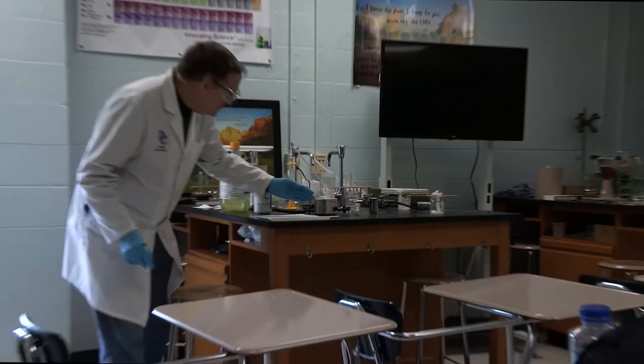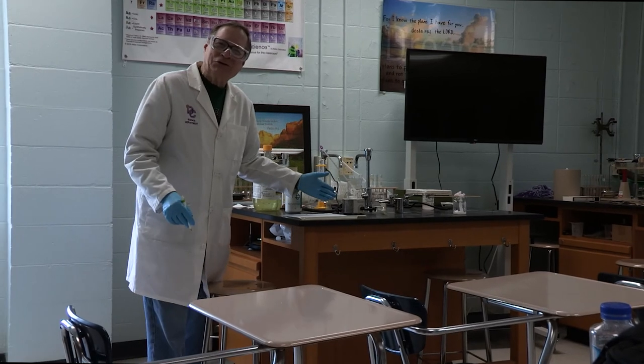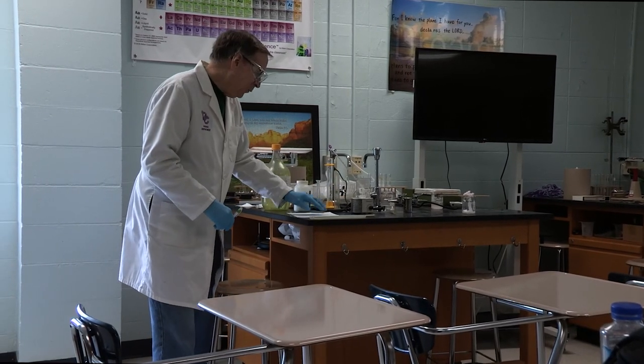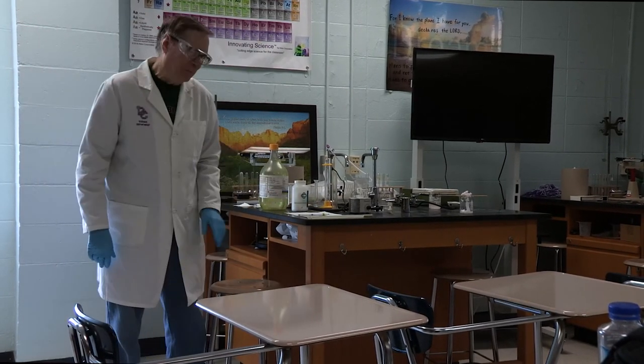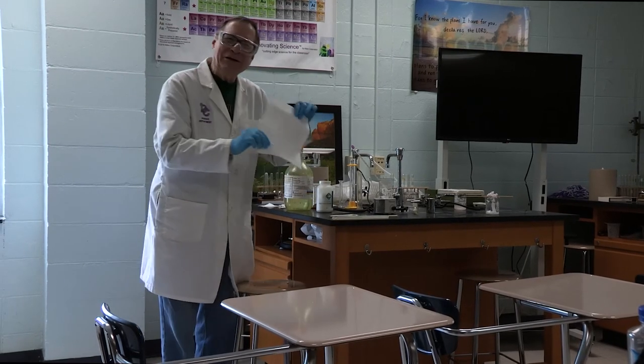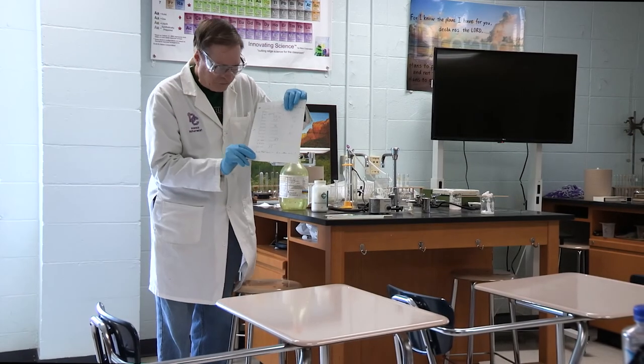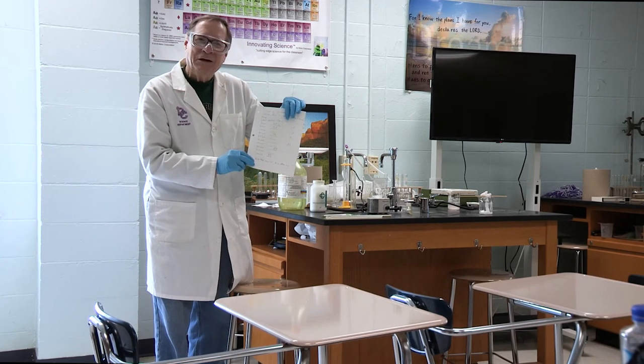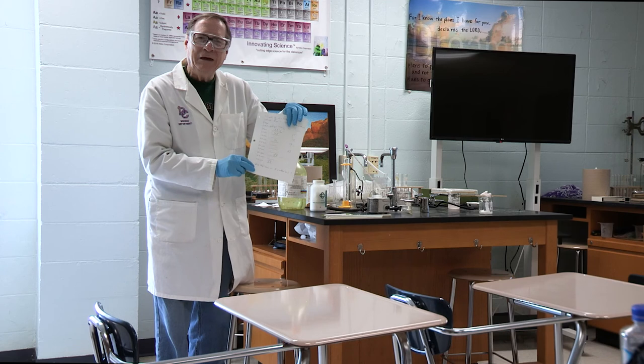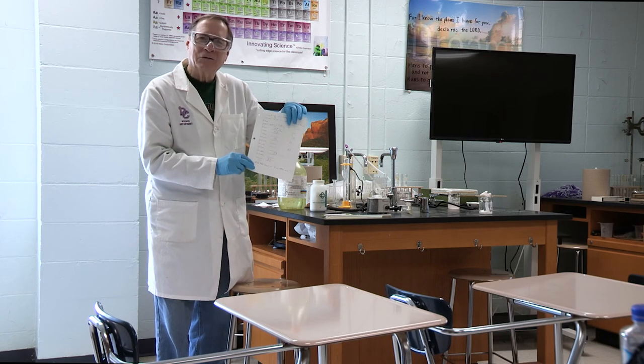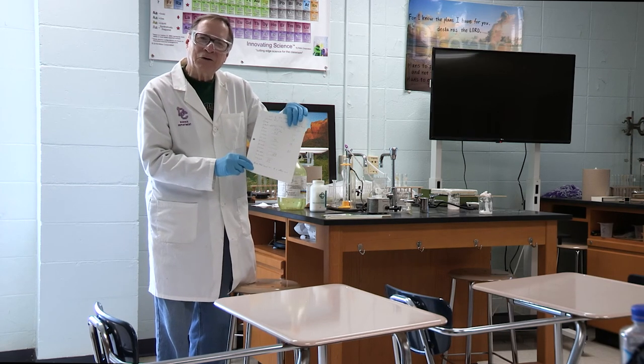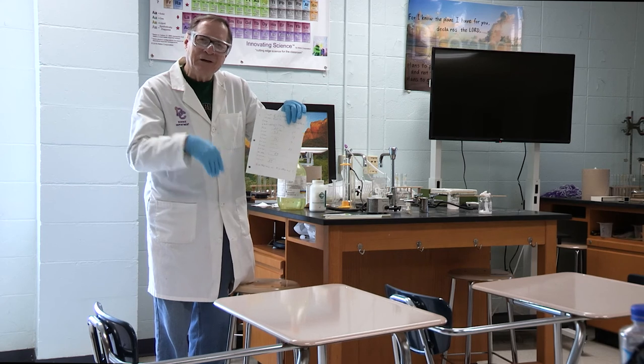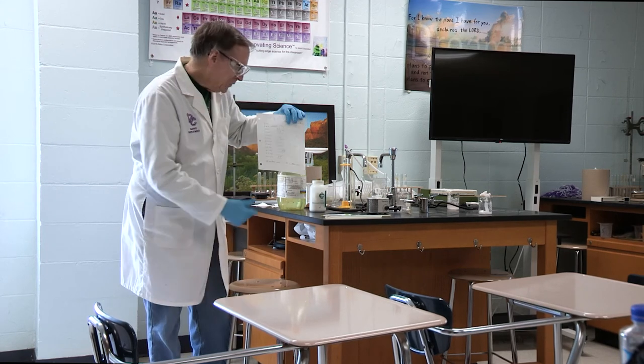Did I heat it? No, this doesn't have a heater on it. It's just a stir plate. All I did was I used heat of solution. Now, here's the big question. Is this endothermic or exothermic? As I made the solution, it gave off heat. The beaker got hotter. The solution got hotter. So the answer is exothermic.